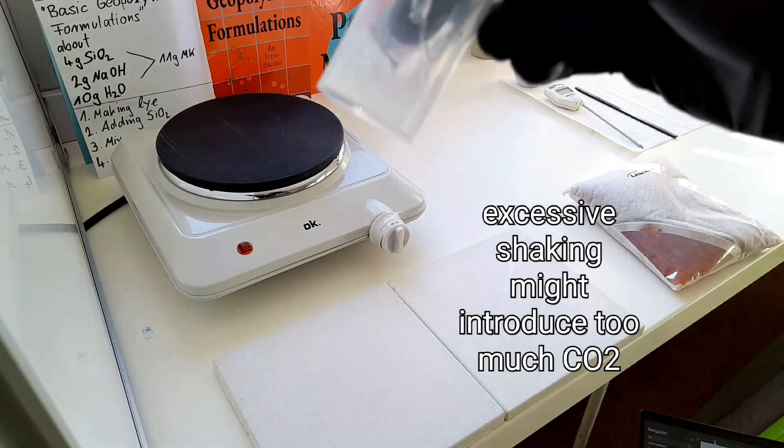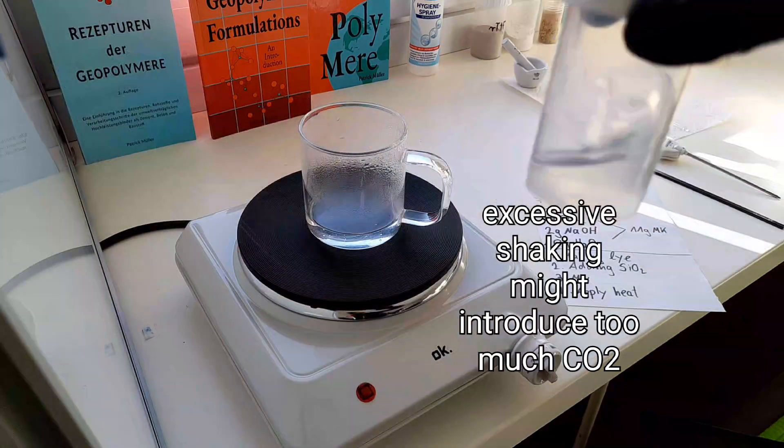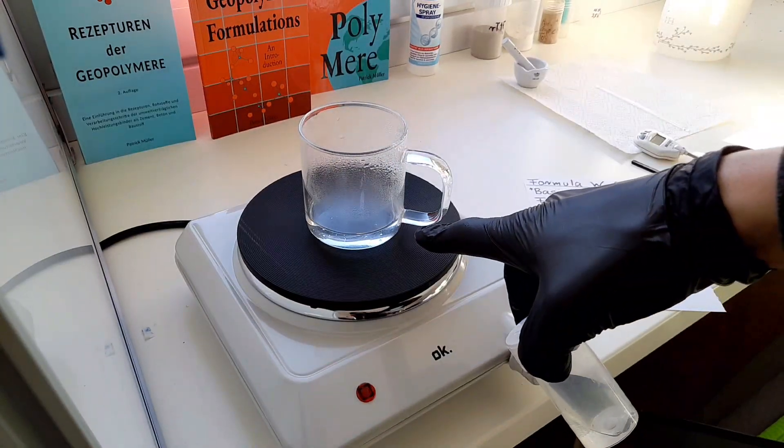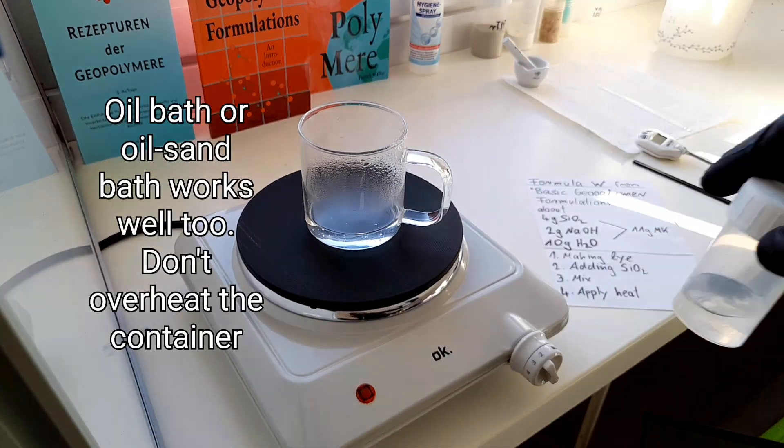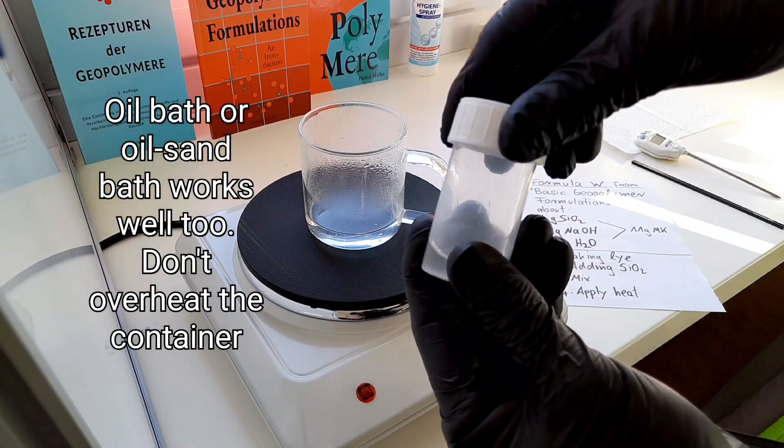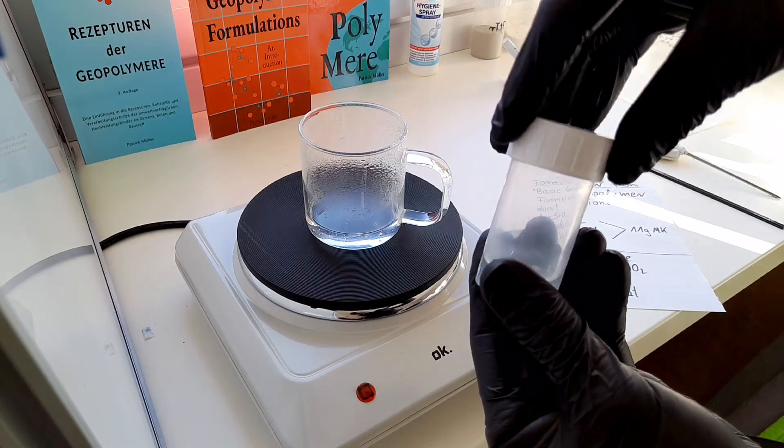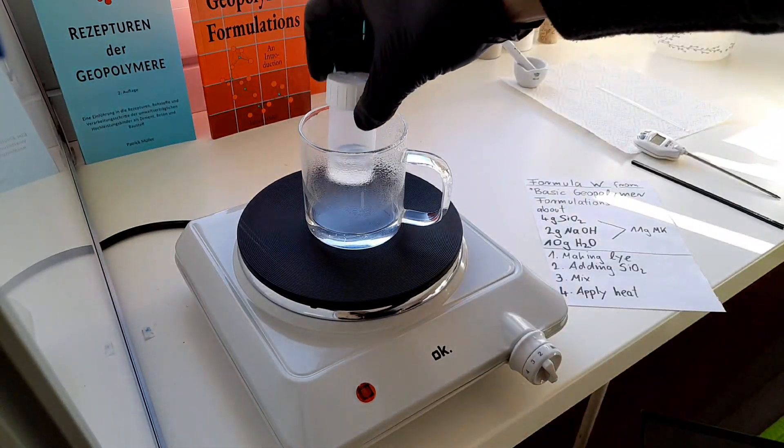By now I can predict that we need some heat, and we added some water. It is relatively hot. I open the container a little bit so pressure can go out and put it in.